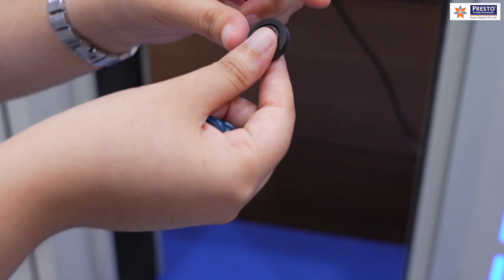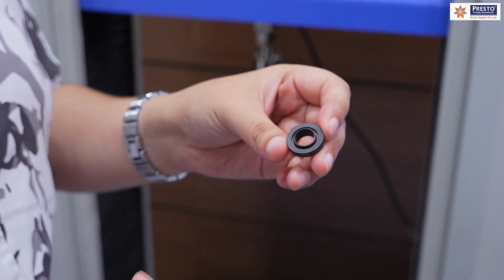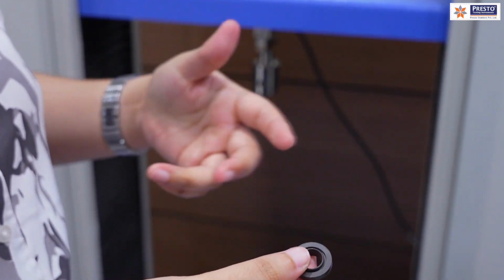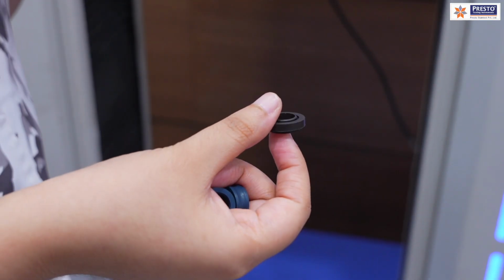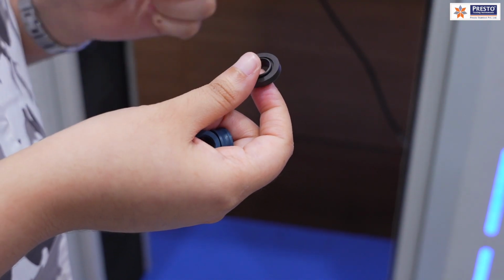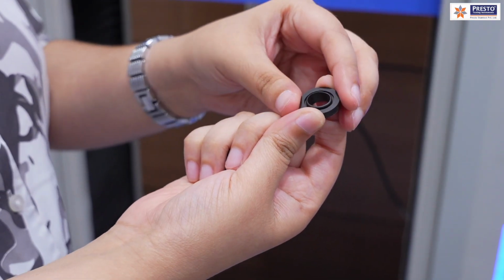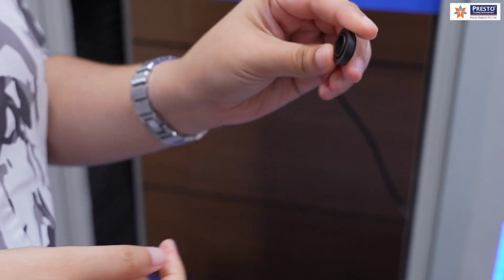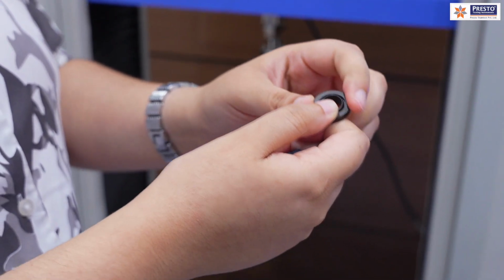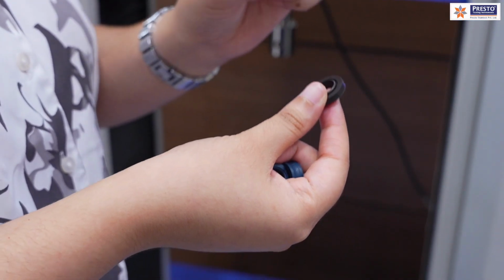So it is very important for these O-rings to have good mechanical reliability because they undergo tension and too much expansion while they are in the application. Even in the space industry, in cryogenic applications, these are under very cold conditions, so they tend to contract because they are rubber in nature. To check the tension and compression, it is important to have proper standardization.